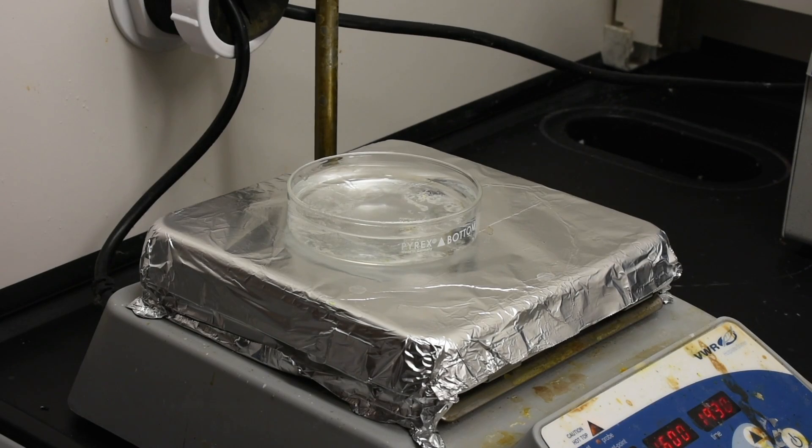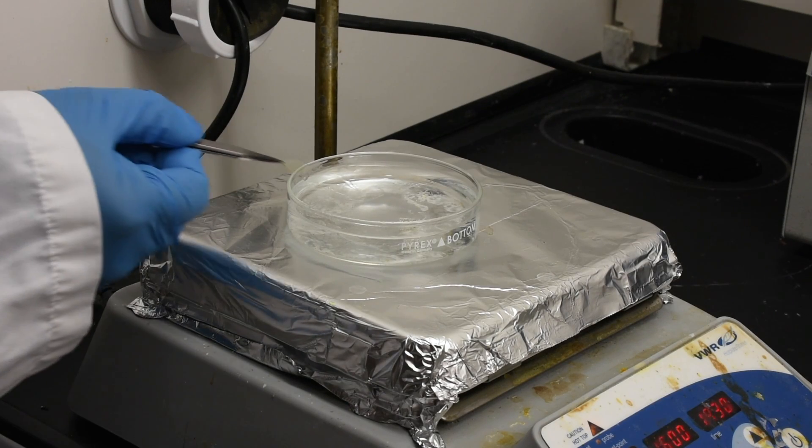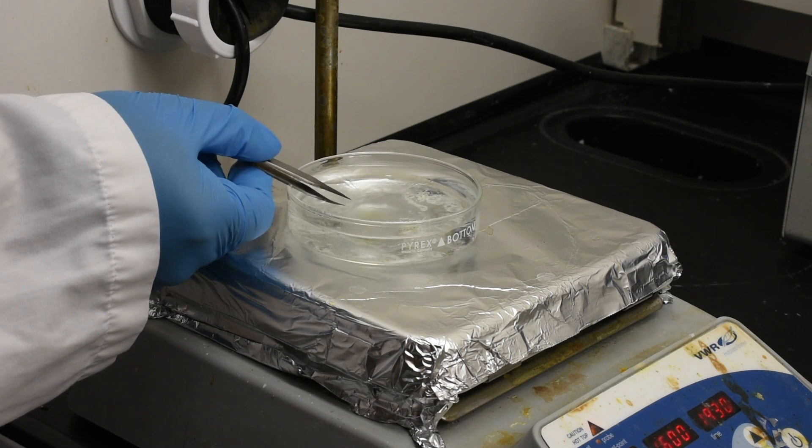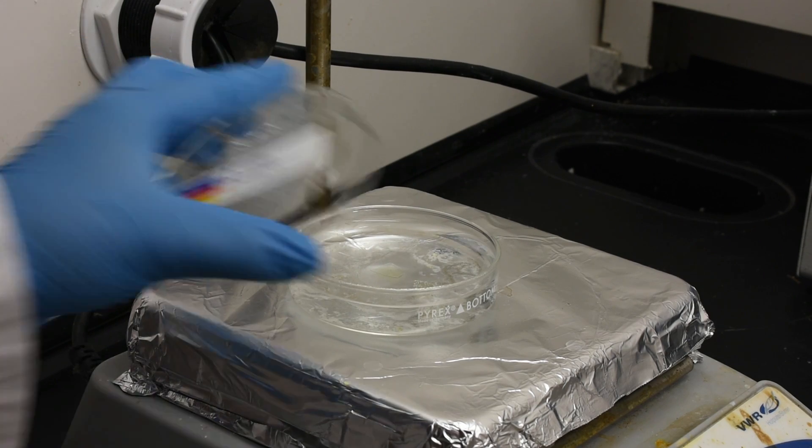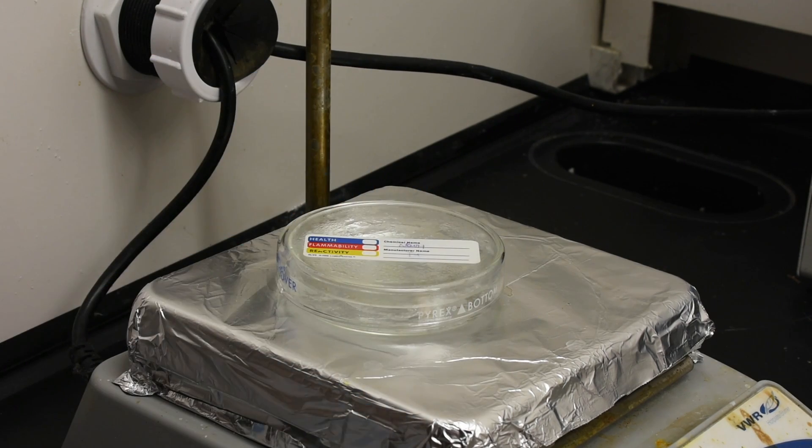The sample is then put into a DI water bath at 90 degrees C. After 5 minutes, we begin to look for signs of delamination of the PMMA and thin film from the sapphire wafer.